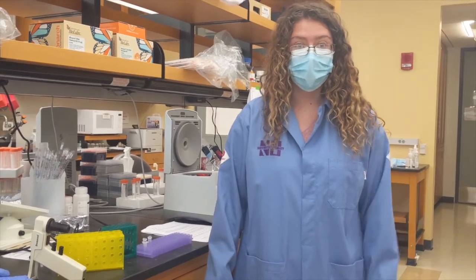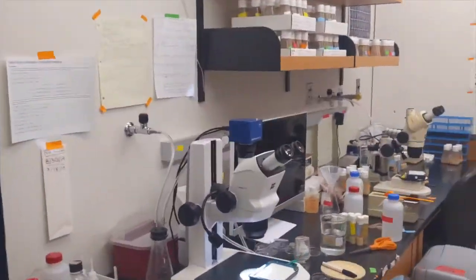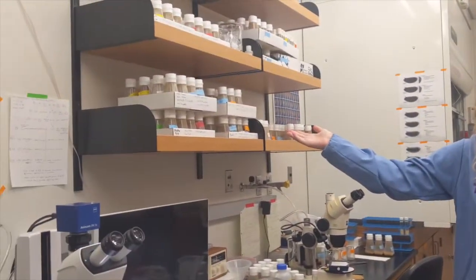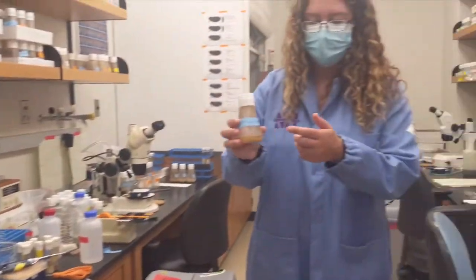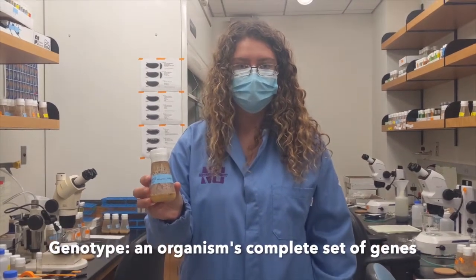Now, I'll show you the fly room. This is what we call the fly room. It contains many bottles of different types of flies, as well as hundreds of vials of different fly strains. The tape on the bottles and vials tells you the genotype of the flies inside.